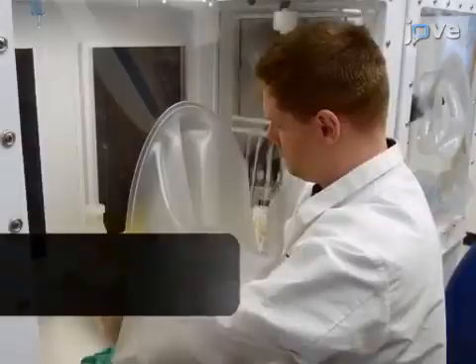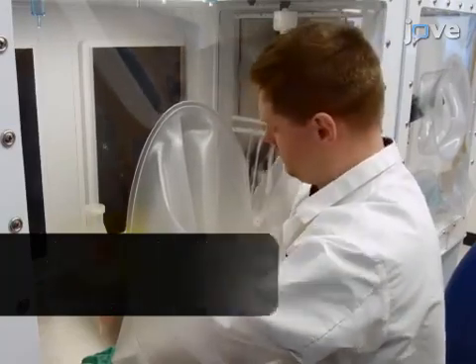Whether it be manipulating the cells, in the incubator, or on the microscope, their exposure to oxygen, CO2, and temperature is constant throughout the cycle. Demonstrating the procedure will be Alexander Stover, a staff scientist in my laboratory.